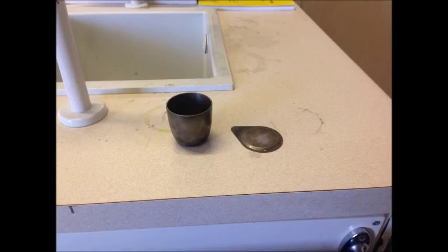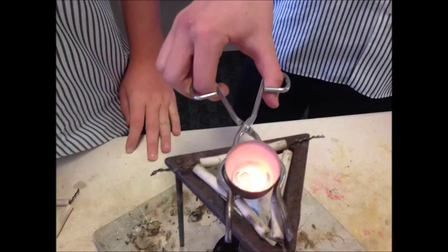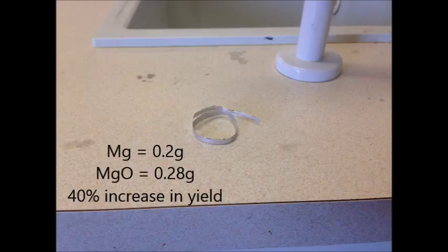Once the crucible and lid have cooled, you can place it back on the weighing scales. Before the reaction, the crucible, lid and magnesium weighed 30.77 grams. Now the crucible, lid and magnesium oxide weigh 30.85 grams, a total of 0.08 grams increase. The magnesium went from 0.2 grams to magnesium oxide weighing 0.28 grams, a total of a 40% increase.